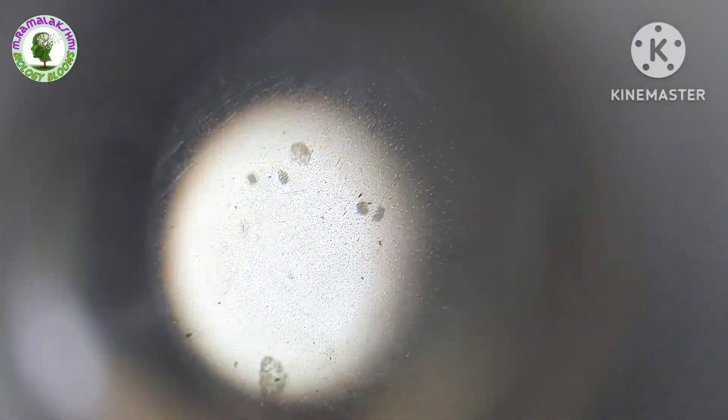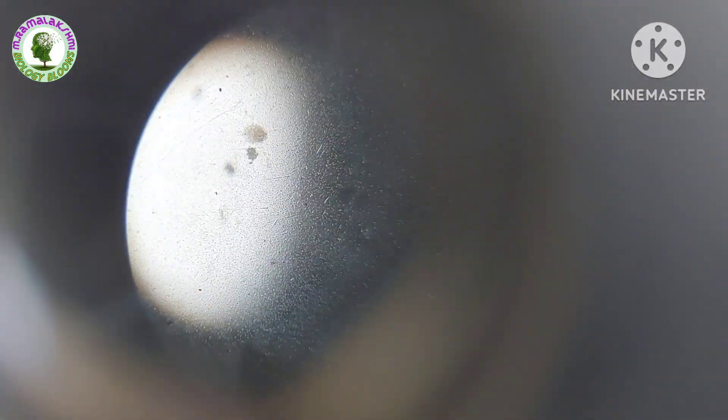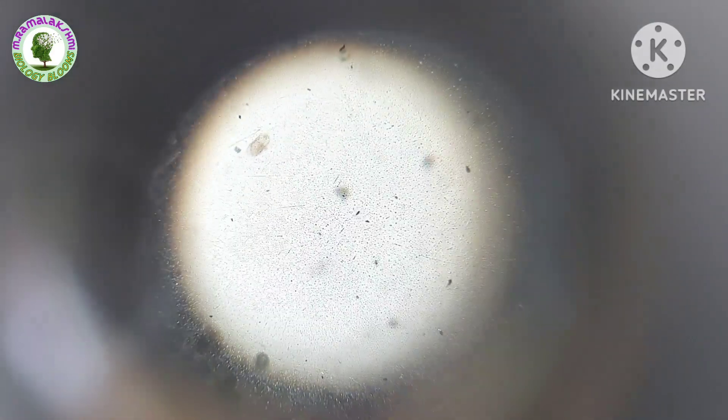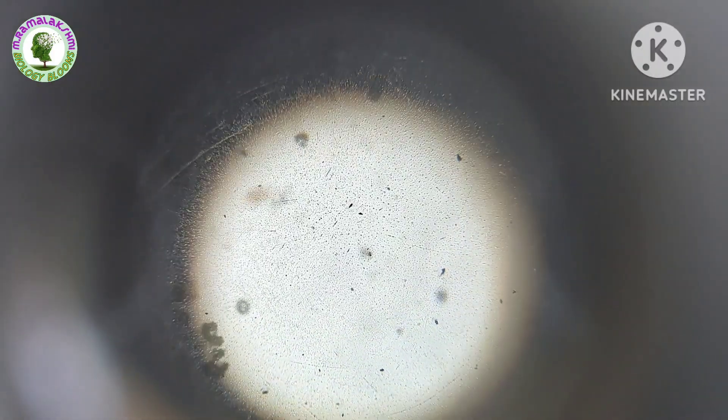Satish, do you find any moving objects? Yes ma'am. Are you able to see it with your naked eye? No ma'am. No, only under the microscope we are observing it. Yes ma'am. Yes, good.